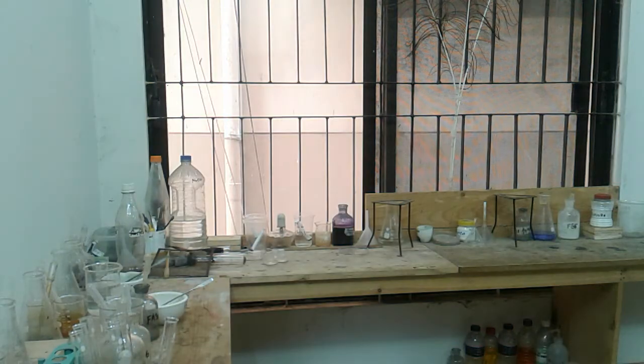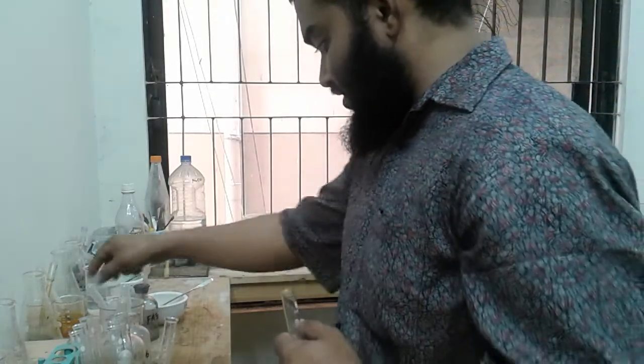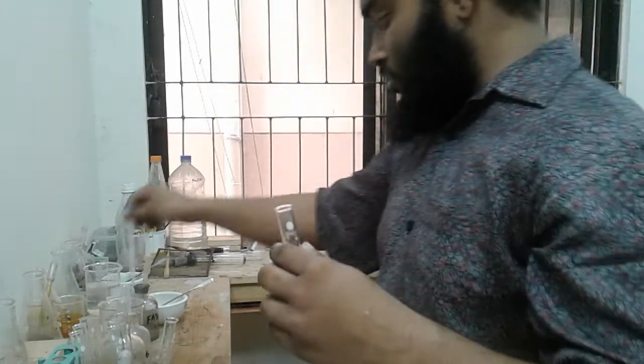Let's see. Oh my god, that hurts. So Fa3C. I'm taking a small amount.